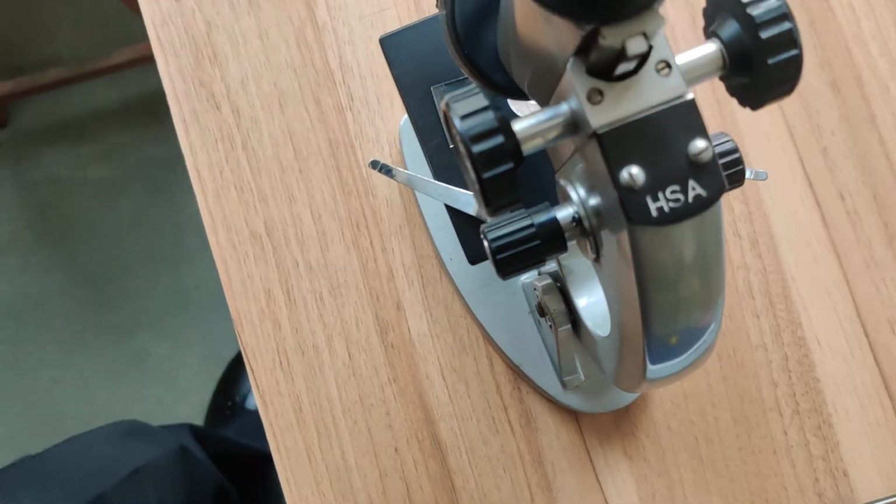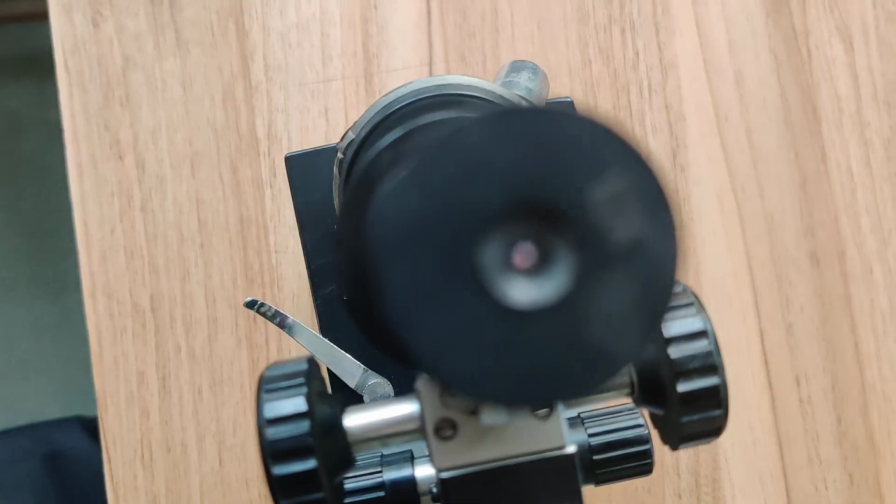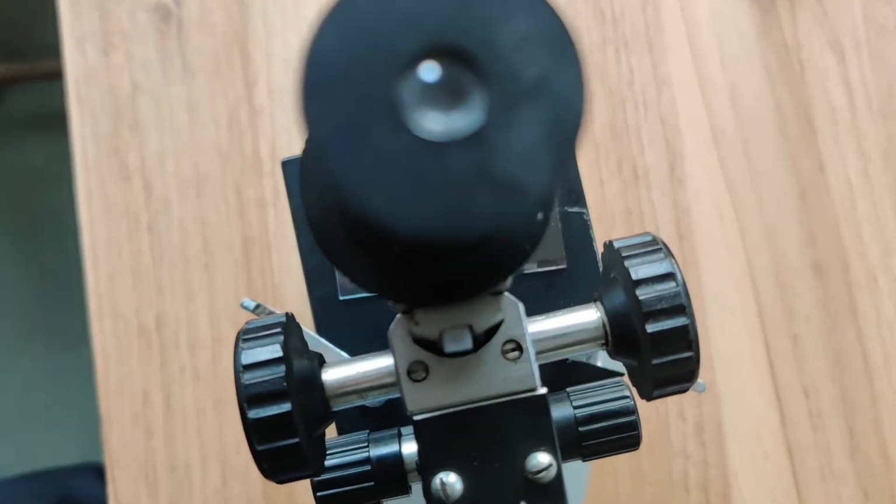Here I already fixed the transverse section of ovary. I would like to show you. See, I think you can see it, the partition in the ovary, and in each chamber this ovule 1 and this ovule 2. Okay, thank you.